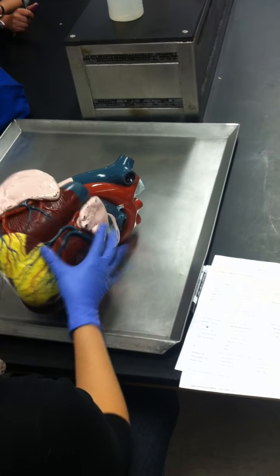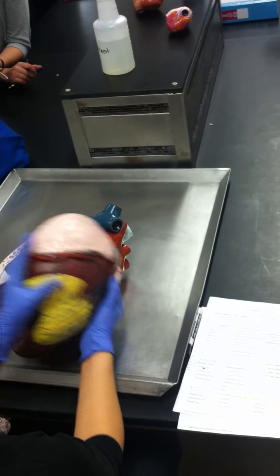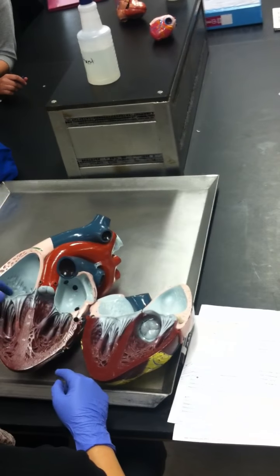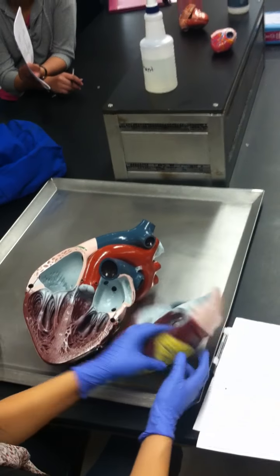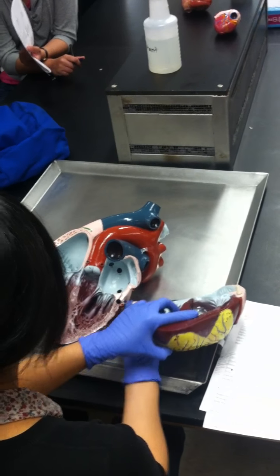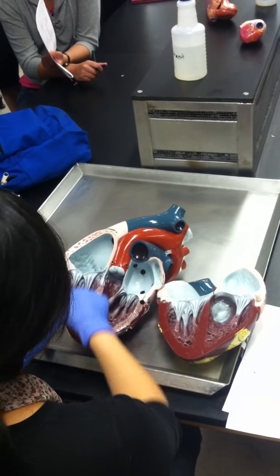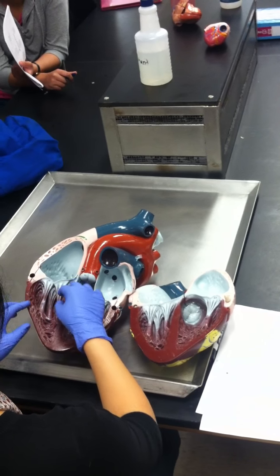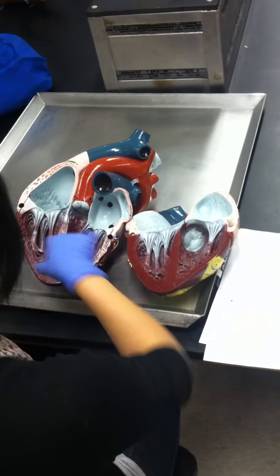So if I open up, right, I said this was the anterior side, right? So if I open this up, what chamber do I have up here? This is the right atrium, right? Because we already found out that this is the front. We opened that up, so this must be the right. Then this must be the left atrium. This then is the right ventricle, and then the left ventricle, right? So if I have a tape, you guys will tell me which chamber. So make sure you clearly know which chamber is which.